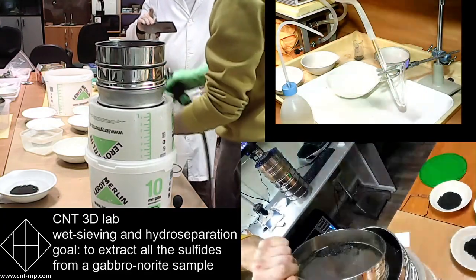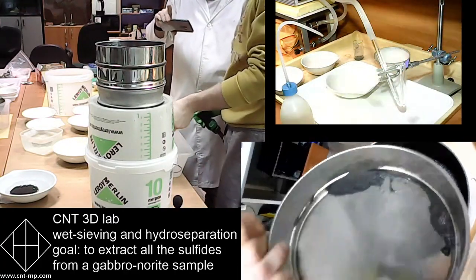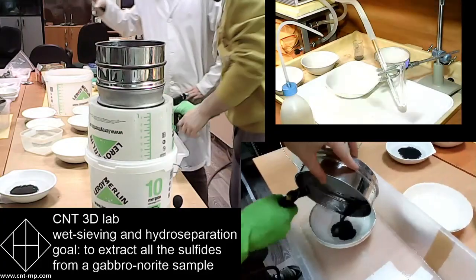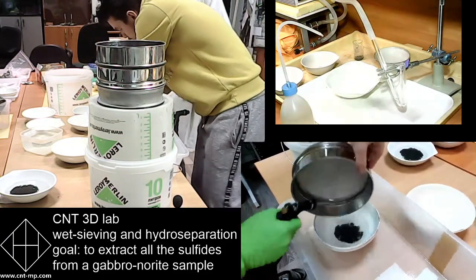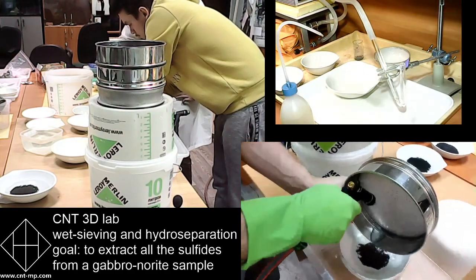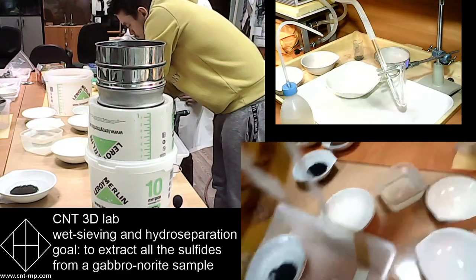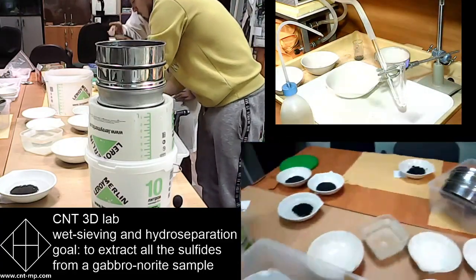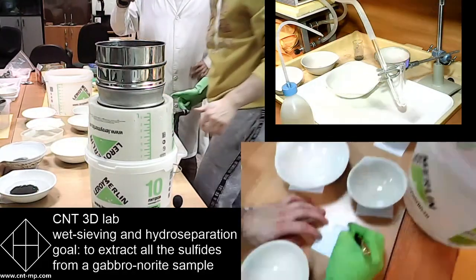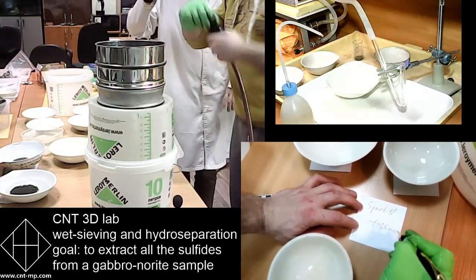So he washes the sieve from below into the sieve that is underneath. You can use any water source, but we use the water from the tap. Here it is. So this is the whole amount of plus 0.5 millimeters from the same sample. Okay, that's done. So we have a special place for the sieves.